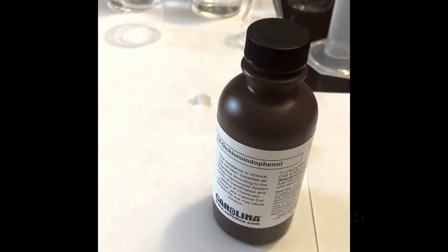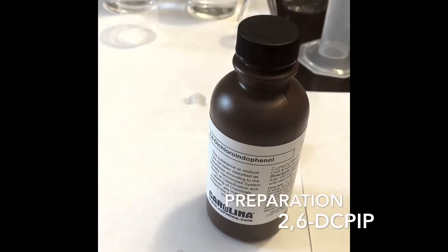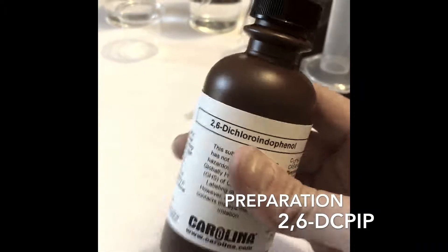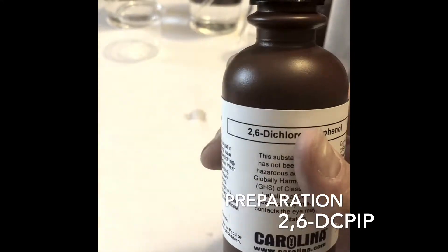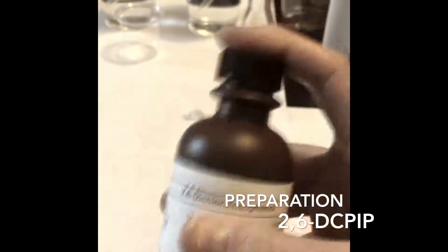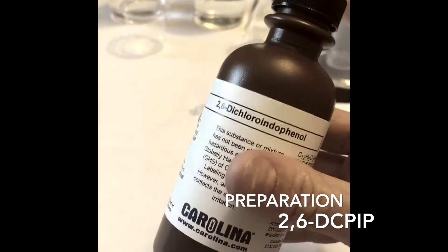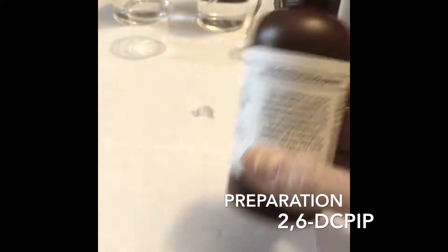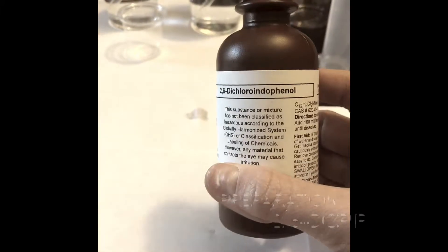Next, we're going to prepare the 2,6-DCPIP solution. I've added 100 ml of pure water to this bottle and we're shaking it up right now. This ends our preparation for the lab.